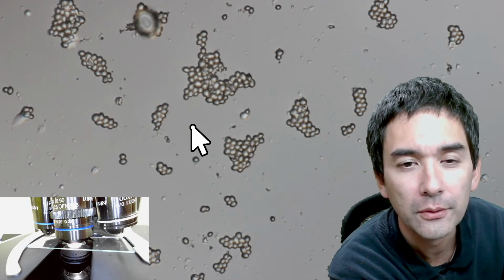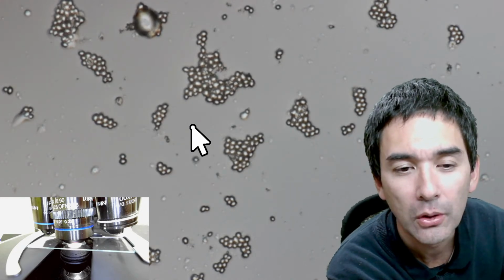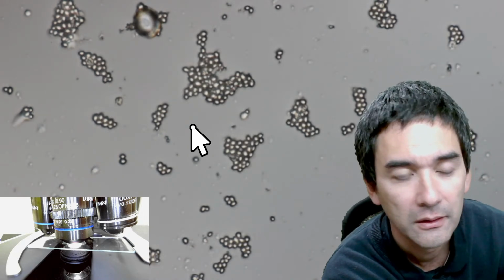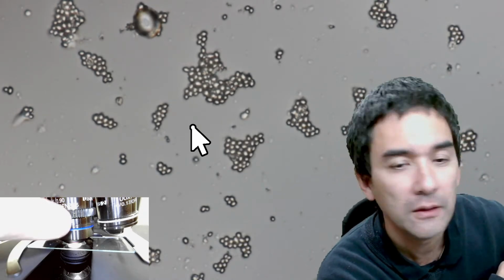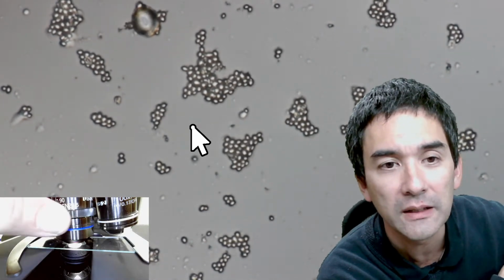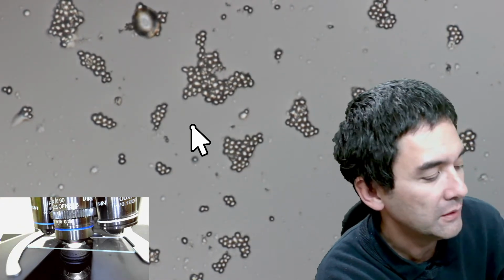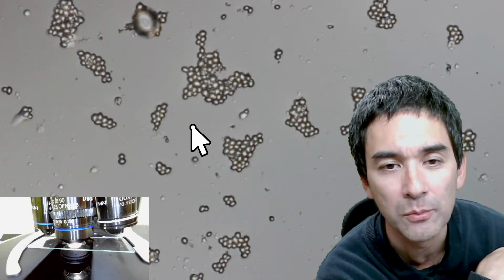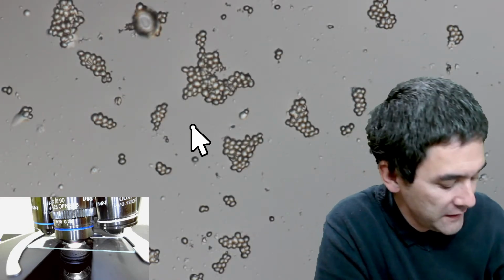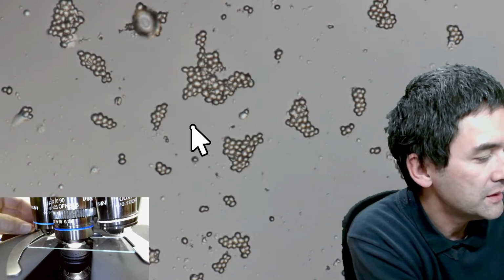And number two, notice that the borders are kind of dark. And this is because it's surrounded by air. There is also no cover glass on here, and usually the lens expects a cover glass for maximum resolution. So what I'm going to do now is heat fix this, and let's see how this then works.